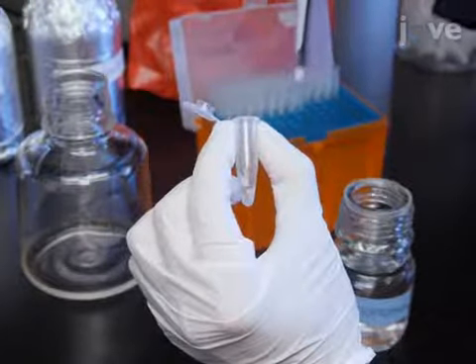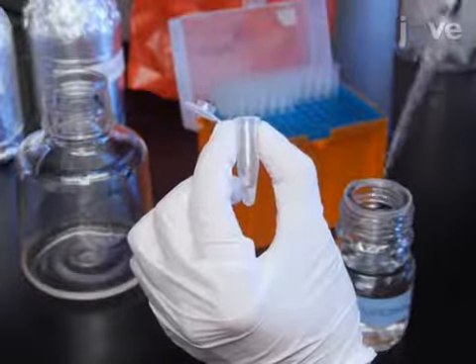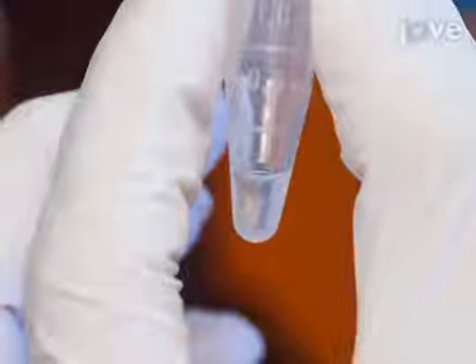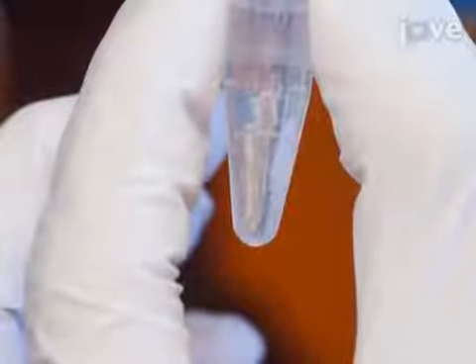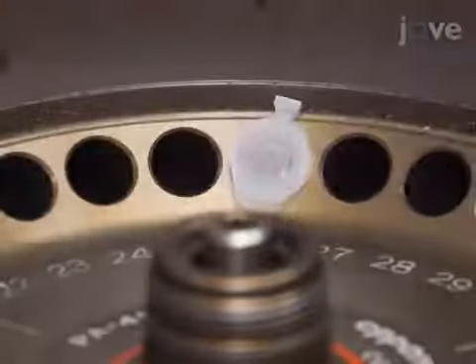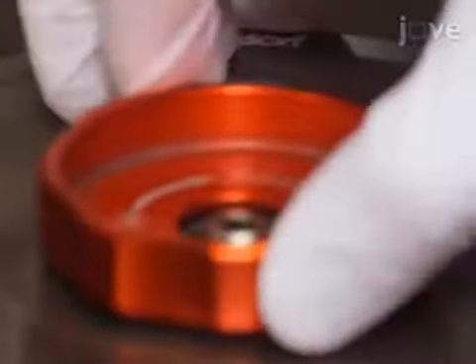Next, to the worm pellet, add 100 microliters of 40% isopropanol, or 60% for ORO staining, and incubate the sample at room temperature for 3 minutes. The addition of isopropanol is crucial for proper permeabilization of the worms before staining. Centrifuge the worms at 560 times gravity for 1 minute and remove the supernatant without disrupting the worm pellet. It is important to minimize light exposure during the centrifugation steps.